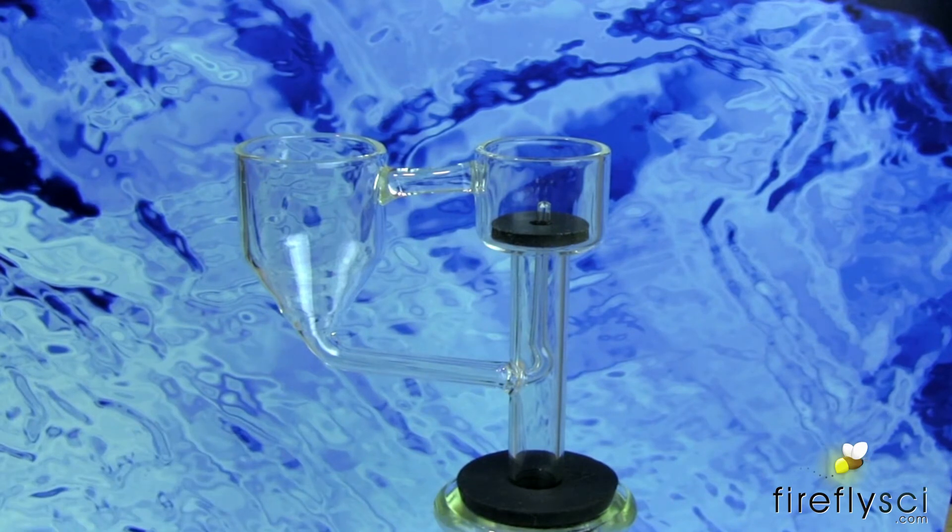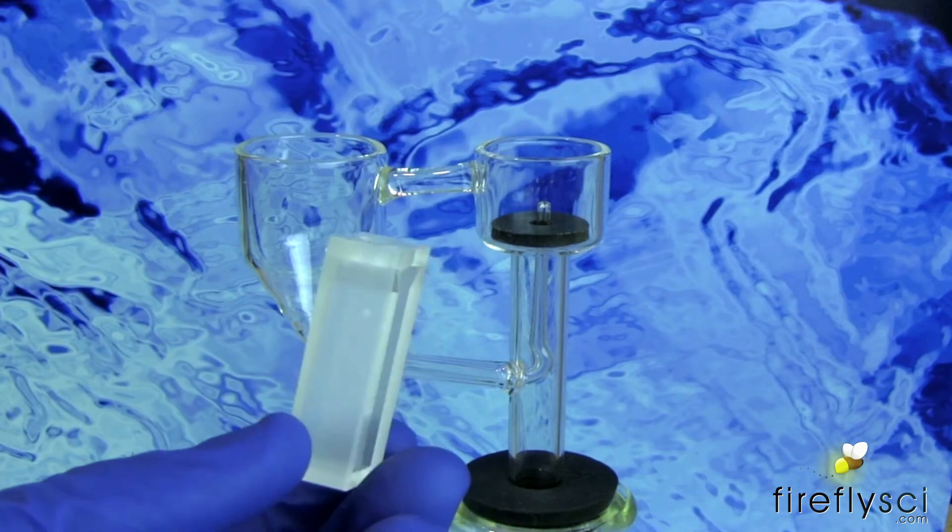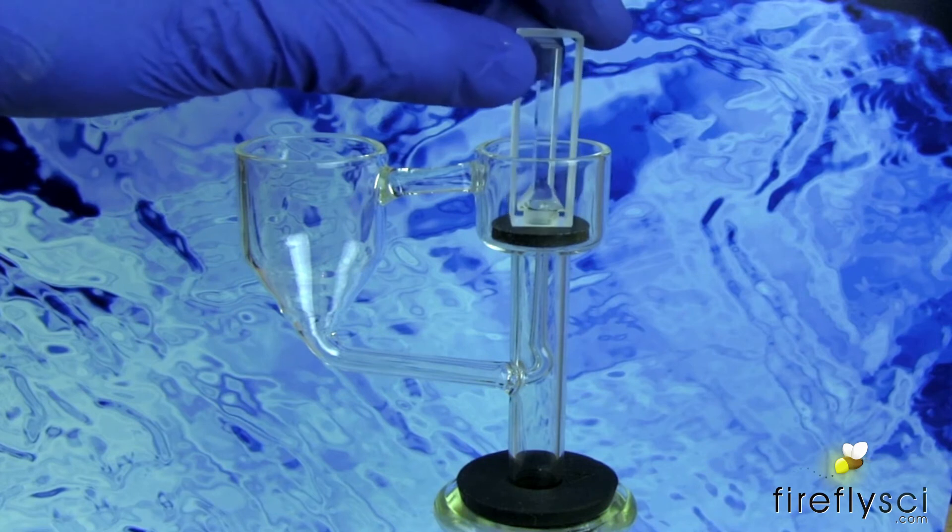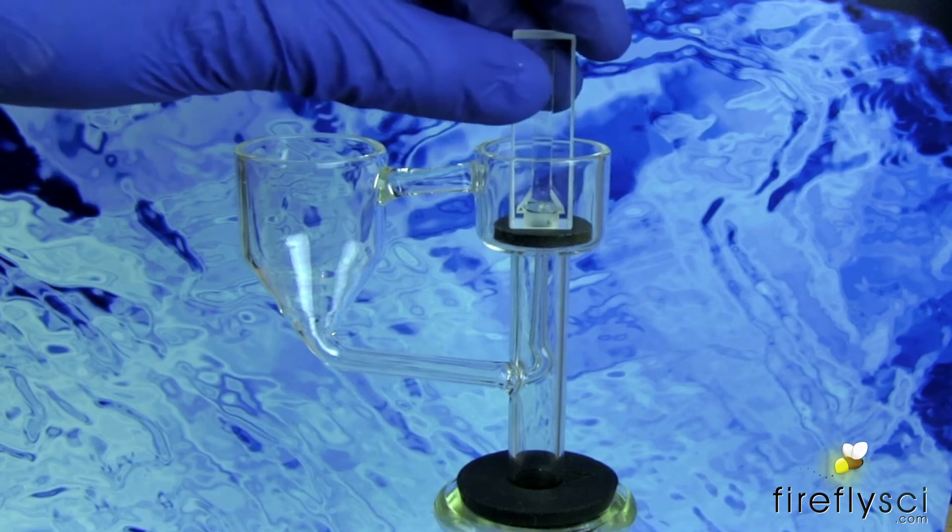Okay, so the first thing you're going to want to do is take your cuvette and insert it right on the cup with the little spout sticking out.